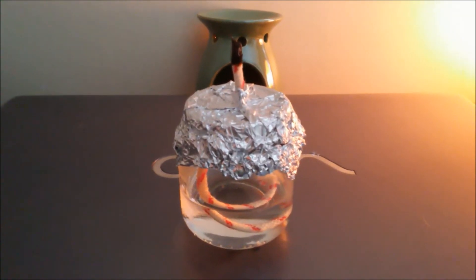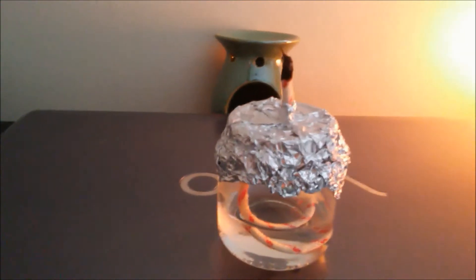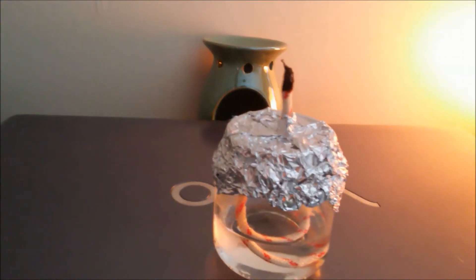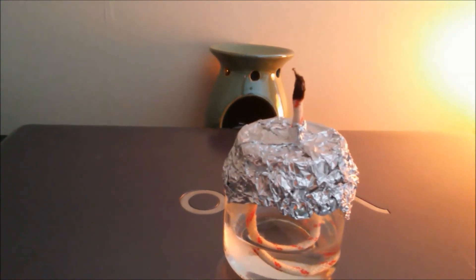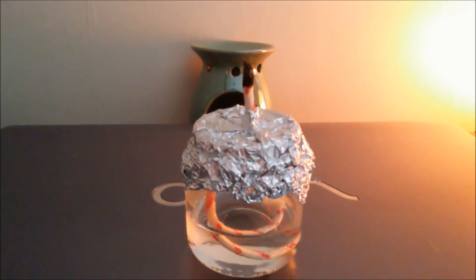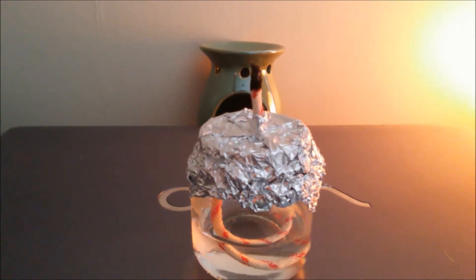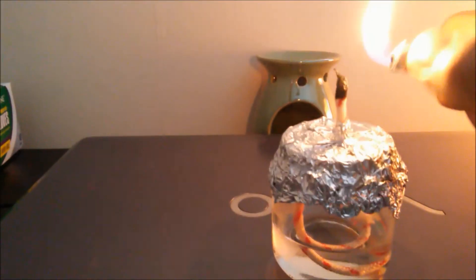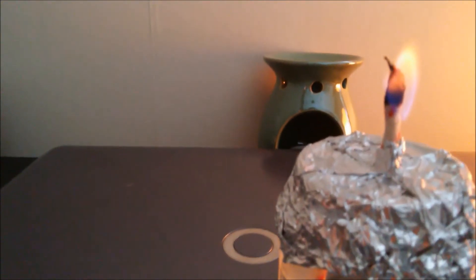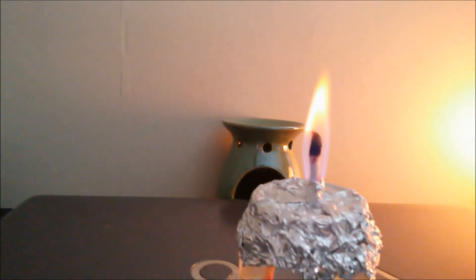Be very careful with this. Don't let it run for too long. You can use this as a stove in emergencies, but we're going to be using this to flame sterilize our needles whenever we do injections, or to flame sterilize our scalpels whenever we do transfers from agar. There it is.